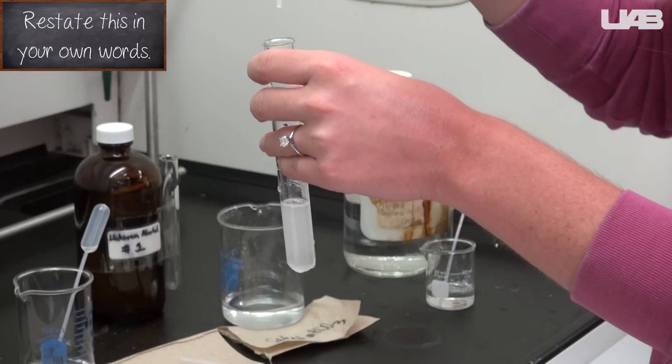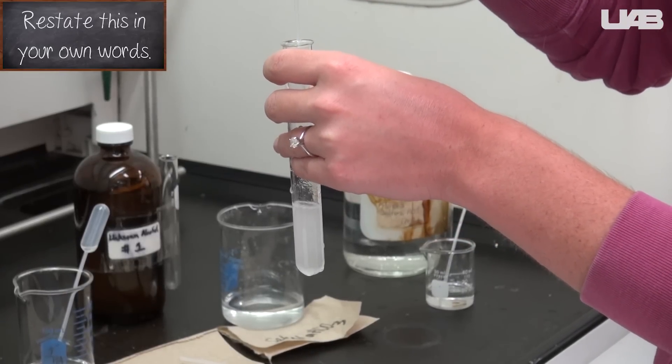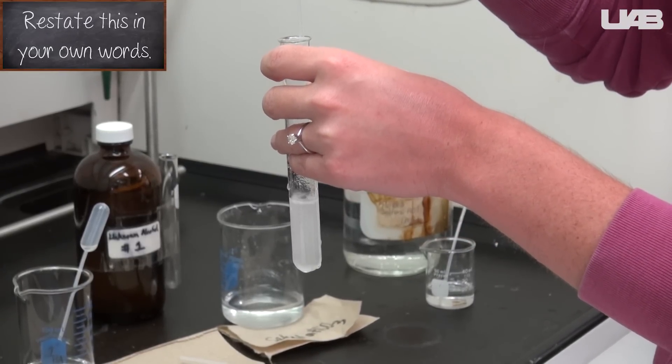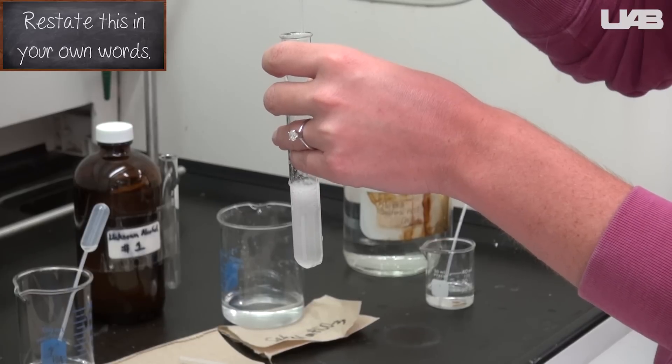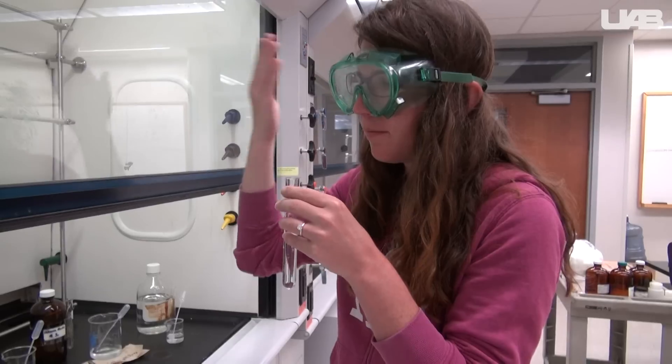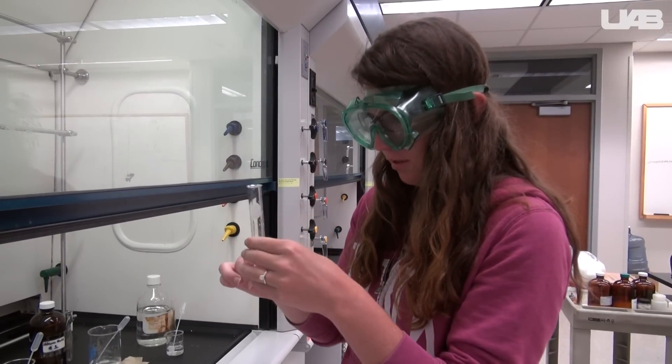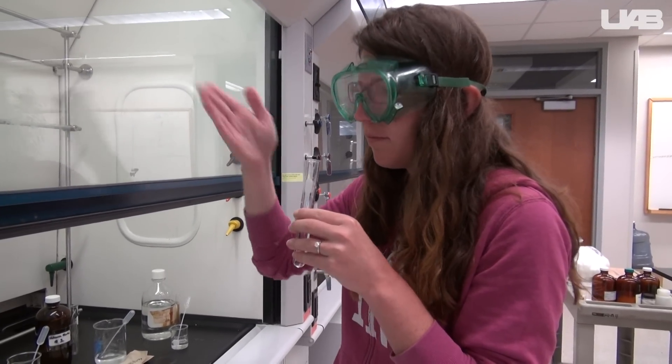Add sodium bicarbonate to help remove the odor of any remaining acetic acid. Keep adding small amounts until the bubbles no longer appear when you add it. Use your hand to waft the vapors towards your face so that you can smell the ester that you've created.